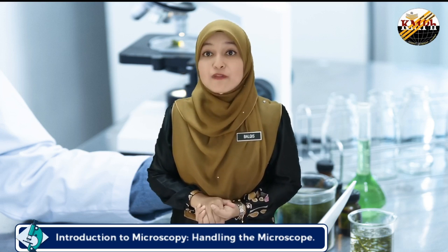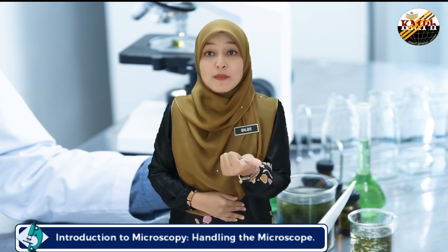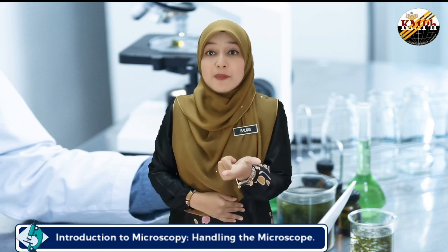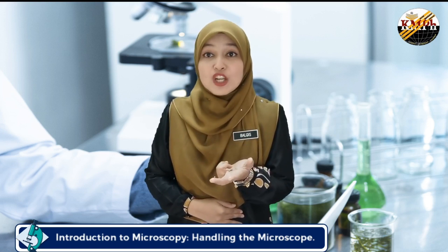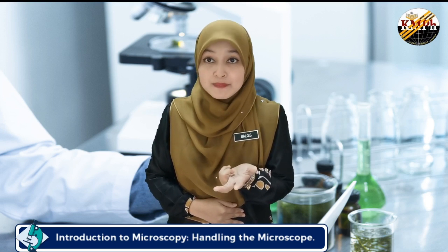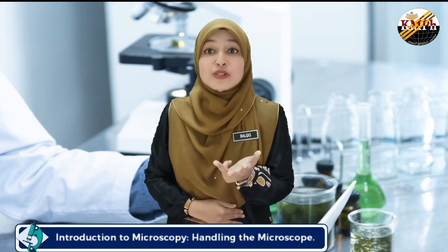In today's video, we will discover about four things. First, setting up a light compound microscope. Second, focusing on a specimen. Third, using the oil immersion objective lens to observe microorganisms. And the last one, storage of the microscope.